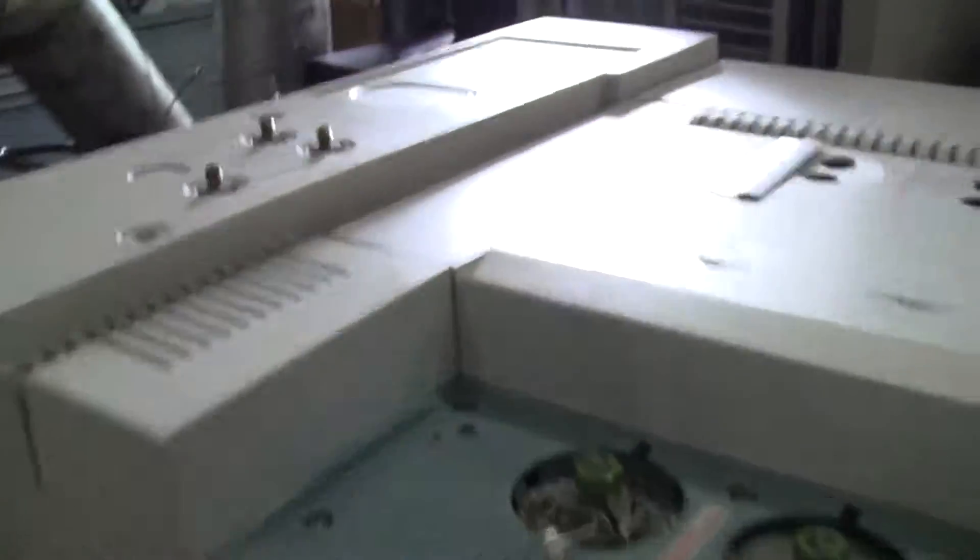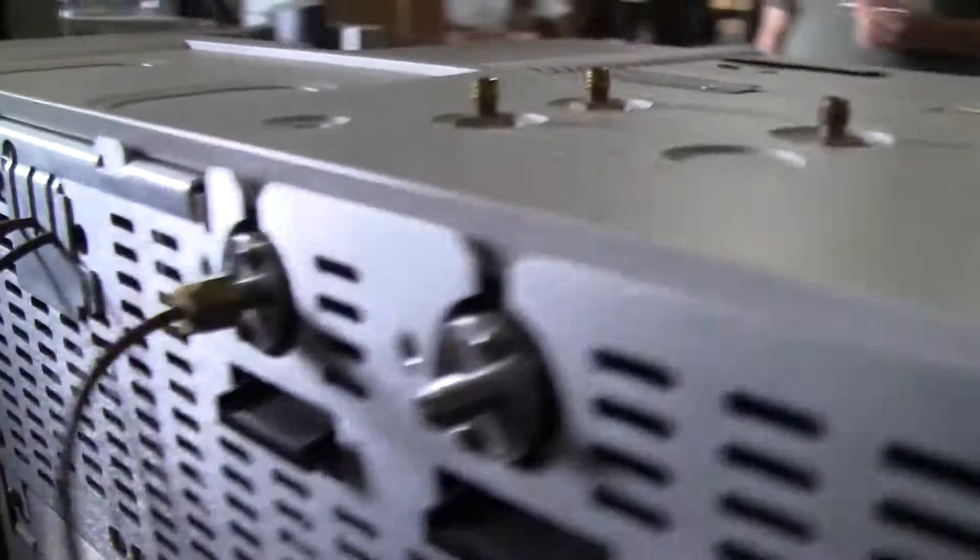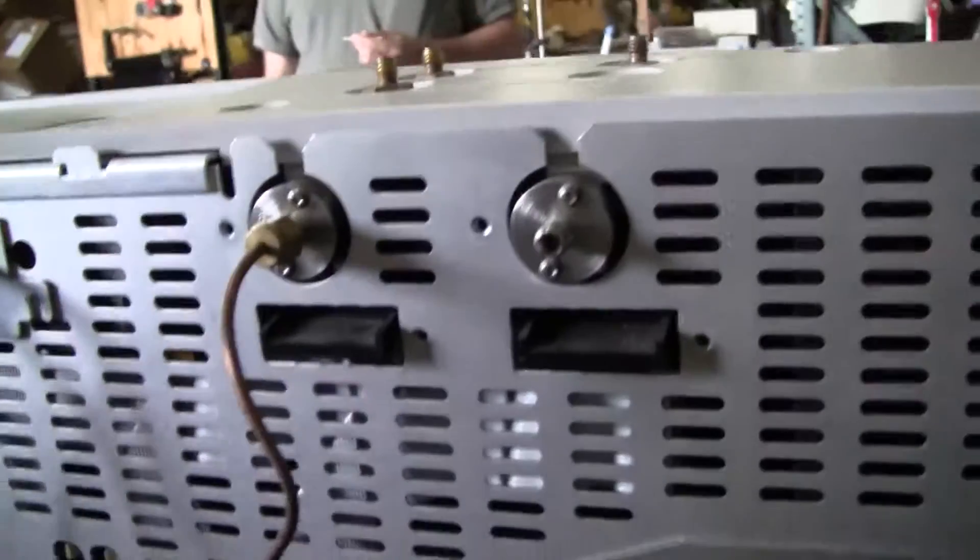Let's take a look at the back. We're running HPIB off of it.